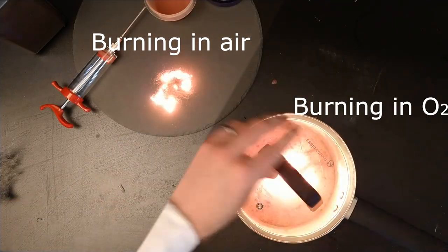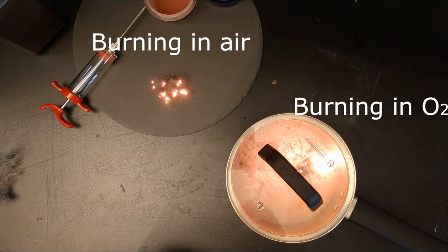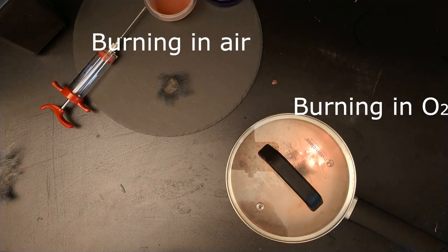What seems to have been working was a suggestion from some viewers who said try hydrogen peroxide, and other folks said try flowing gaseous oxygen across your iron while it's burning. I don't want to submerge the reaction in hydrogen peroxide because if it's concentrated enough to work, it will be dangerous, and if it's not concentrated enough, then I will quench the reaction in the water.